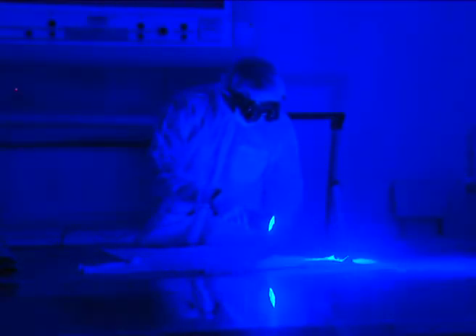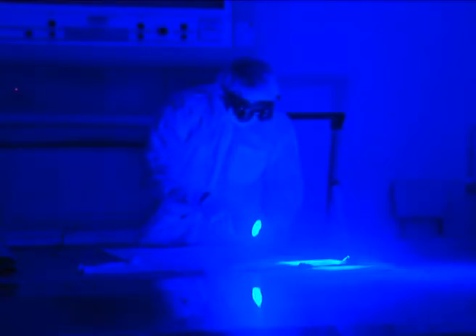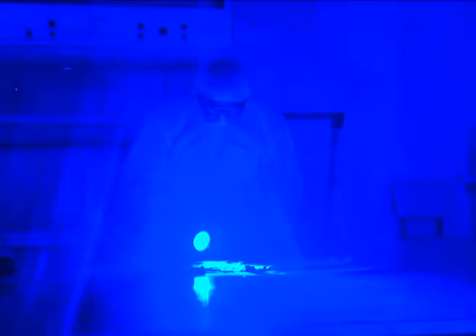Firstly, the scientific officer examines a t-shirt with a crime light to highlight anything that may not be visible to the naked eye, such as fibers or bodily fluid. This highlights areas where DNA may be most accessible.